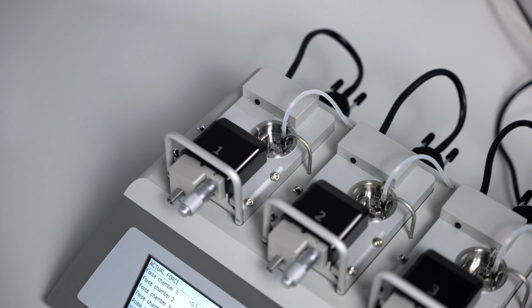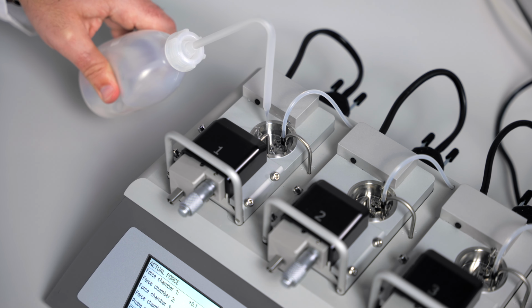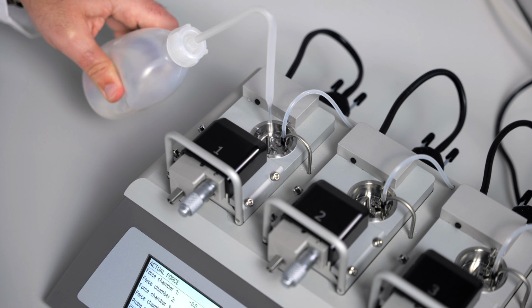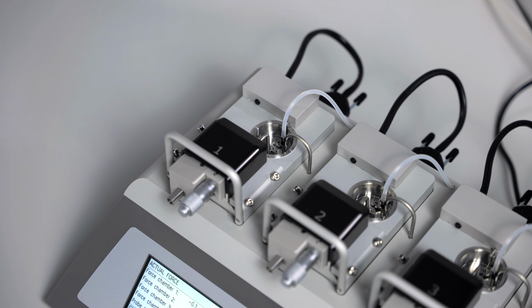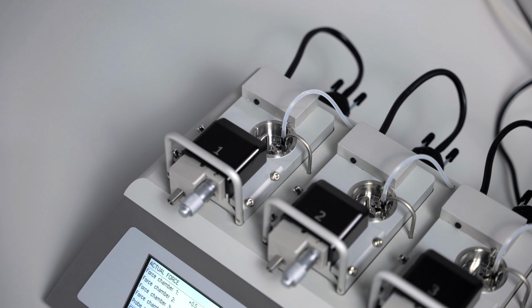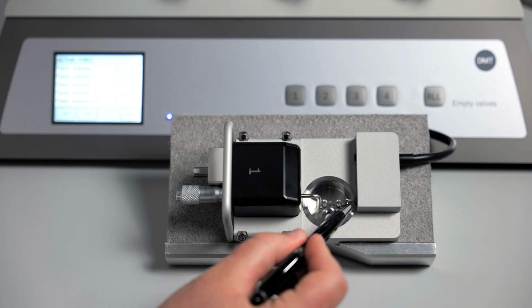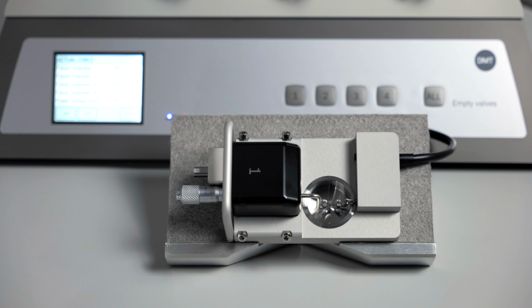After a minute, you can remove the acetic acid and perform 3 washes with double distilled water. After your water washes and drying the chamber, you want to check and make sure that there's a protective ring of the clear silicone grease.